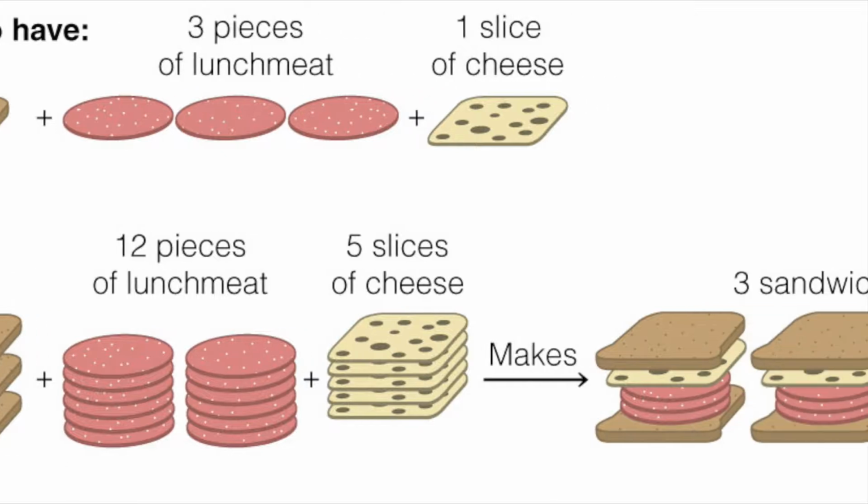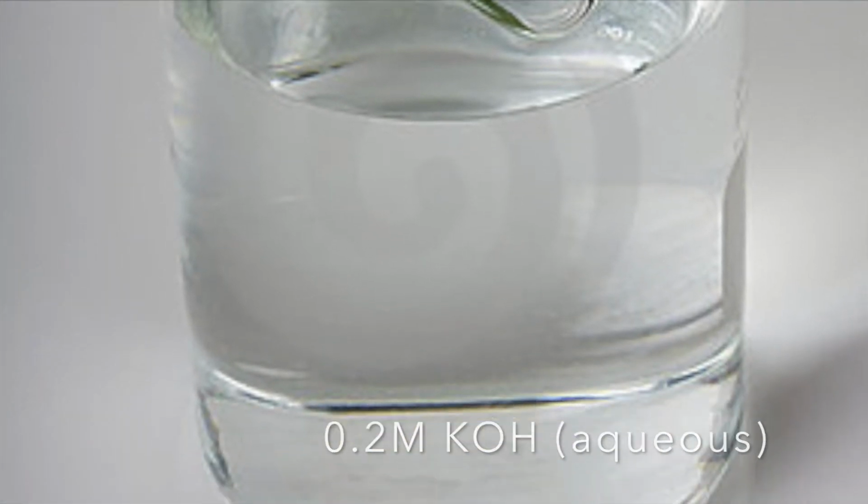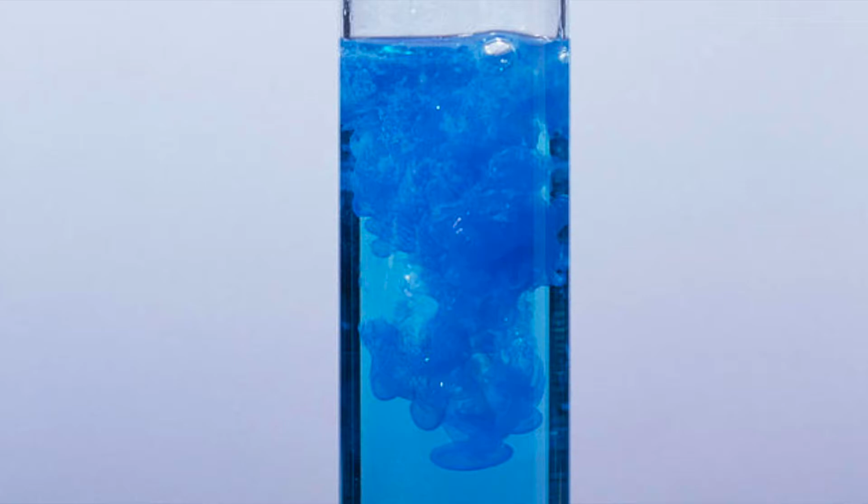The purpose of this lab was to identify the limiting reactant by measuring the precipitate in 8 test tubes at different ratios of 0.2 molar potassium hydroxide and 0.1 molar copper sulfate and observe their chemical reactions.